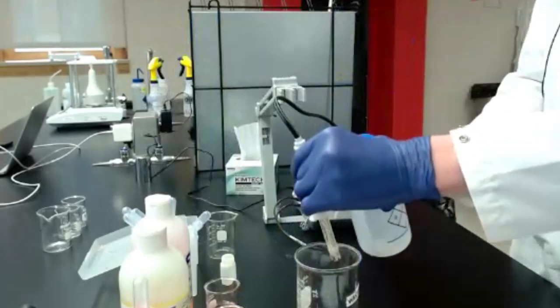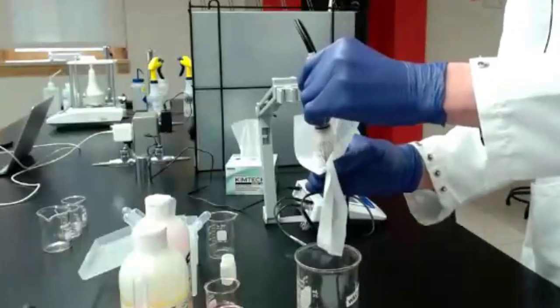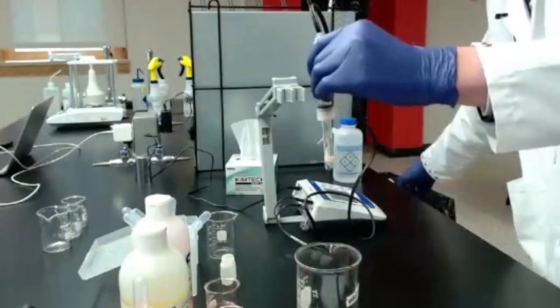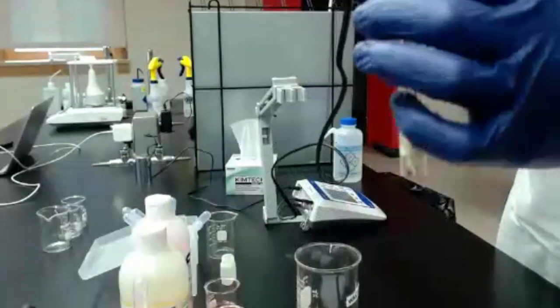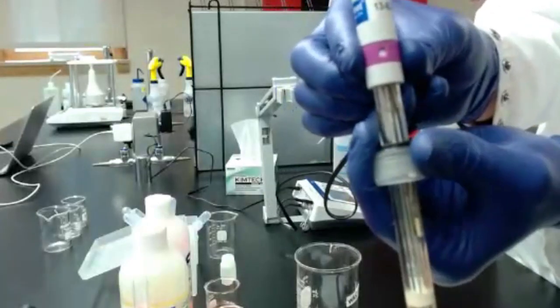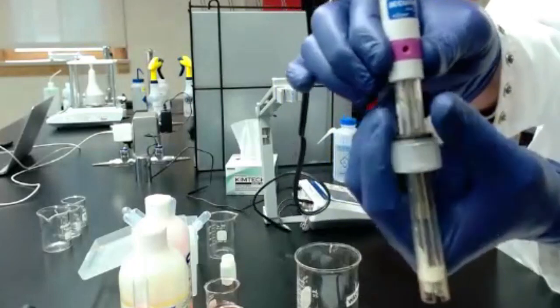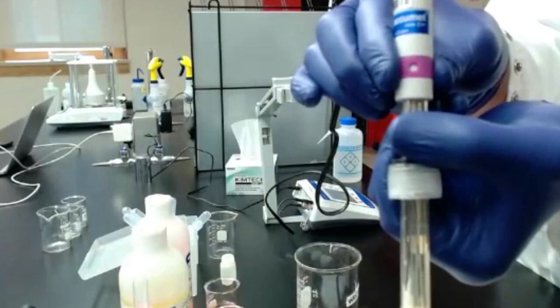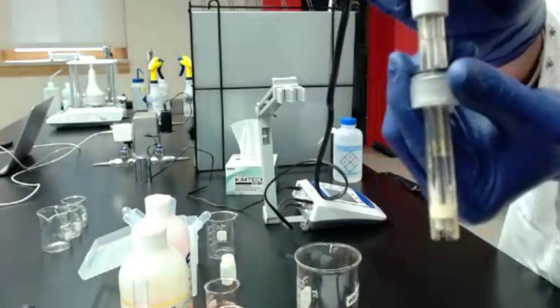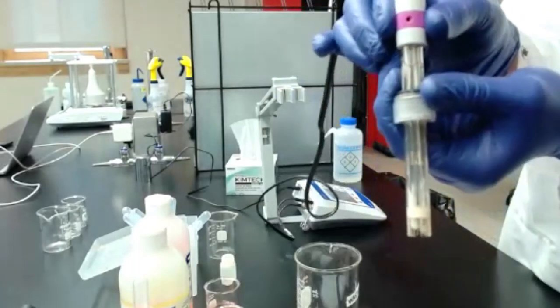I'm going to go ahead and give my pH probe a little rinse here so I don't drip my potassium chloride everywhere. And then additionally, at the top, again, different models might look a little bit different, but most of them will have a little hole that you'll want to twist. You can see that's kind of closed there to open. We want to make sure that's open during measurement. Closed for storage, open for measurement.